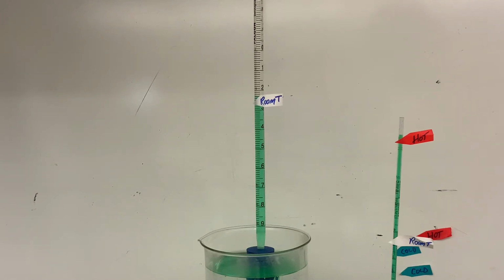All of this is so that we can infer some information about what's happening with water molecules when they are heated and when they are cooled. There you go. You can see the level rising slowly in the wider tube now. I'll admit, a little bit like watching grass grow, but I think now we'll put it in faster speed.